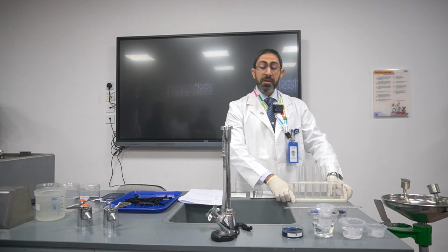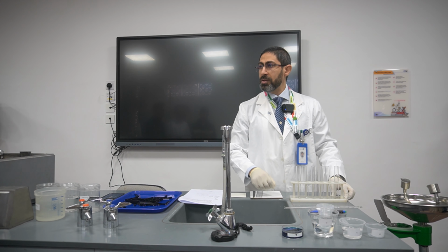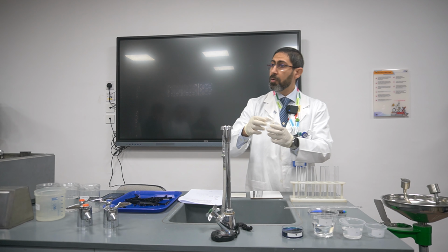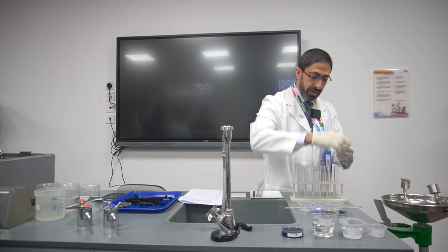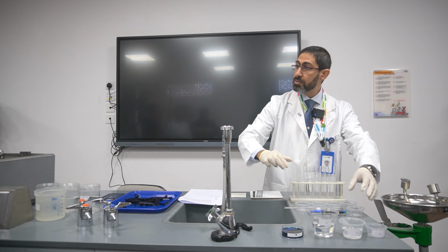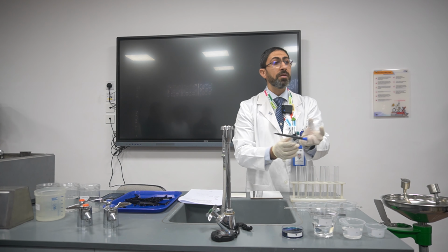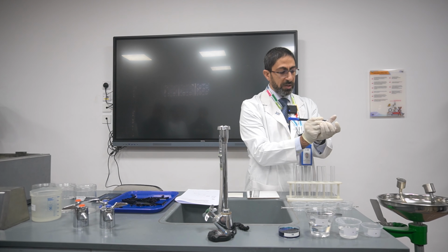First of all, we have to prepare 5 different concentrations of the sodium chloride solution. How can we do this? We should use beakers, but actually I'm going to use these small cups: 1, 2, 3, 4, 5. So I have 5 concentrations. The first one, I will label 10%, because the sodium chloride solution is already diluted to the level of 10%. So I'm going to write here 10%.